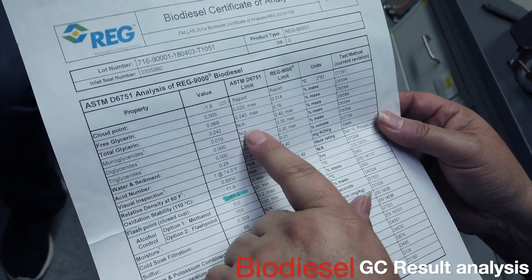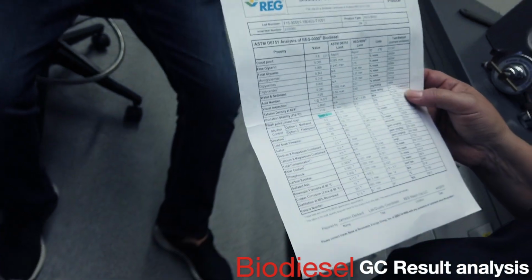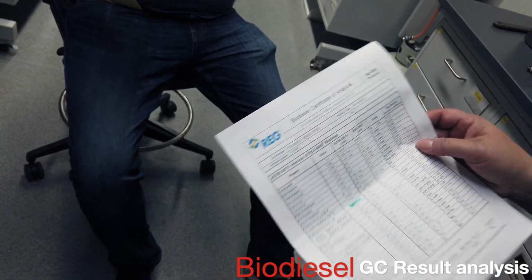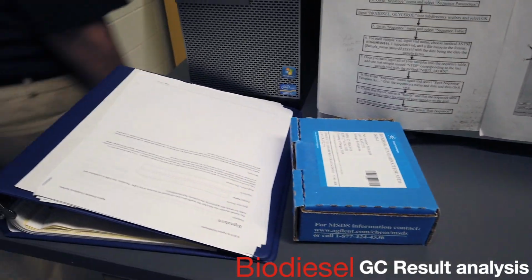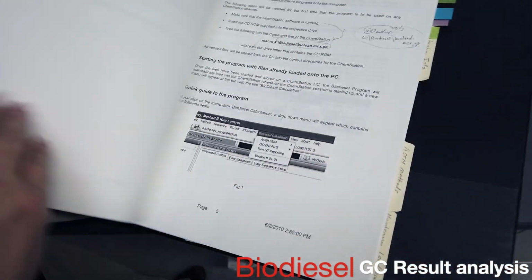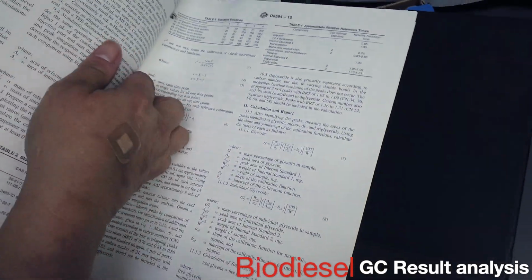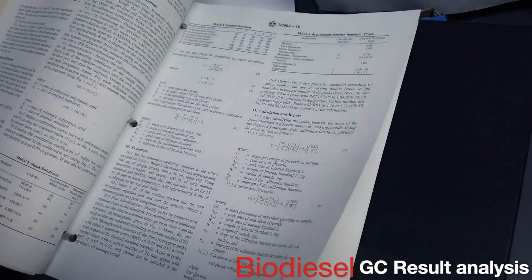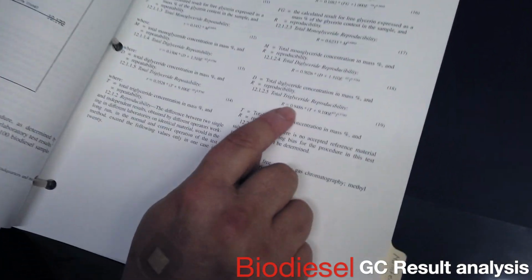There's a limit on monos, but not for the grade of biodiesel that we're looking at. It tells you here. So total triglyceride, that's reproducibility.